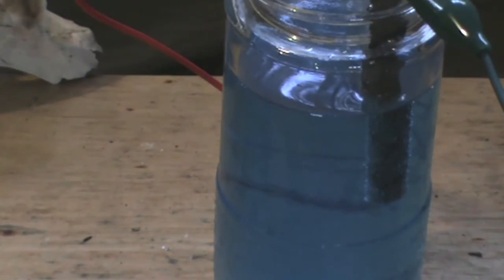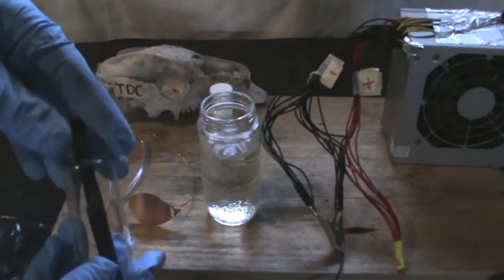The electrode that I will be using to carry out this reaction will be a graphite substrate lead dioxide anode.